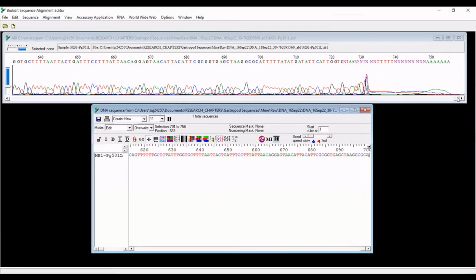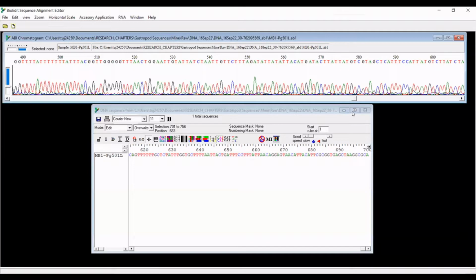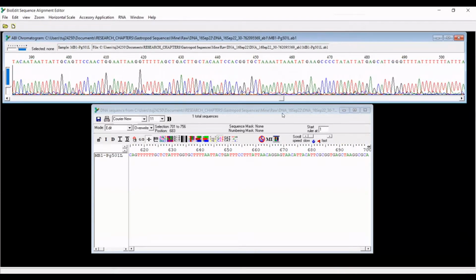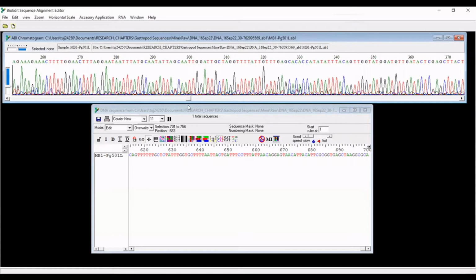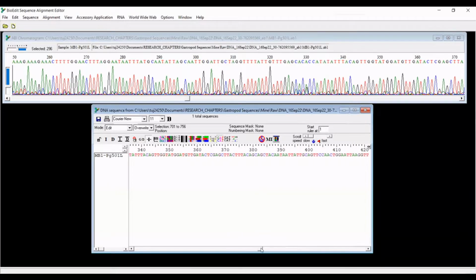And now what I'm going to do is go through, and usually if they've called a base, it's with good confidence that that is the base of interest. However, there are usually some areas where I'm like, I don't know if I agree with the program's call on this. And so let's see if I can find, yeah, so here. So this looks like it is at 290, around 290. So let's go there and see if we can find what base this is talking about. Yeah, so this is G here, 296.